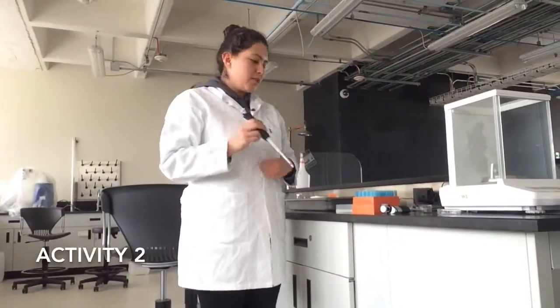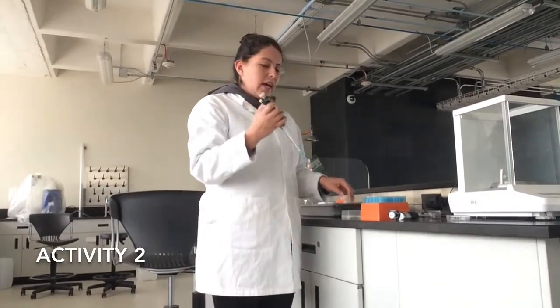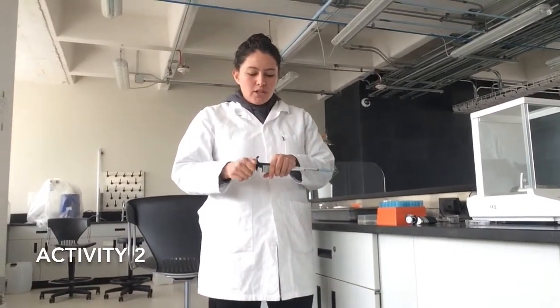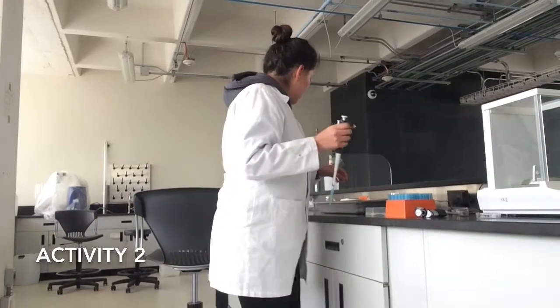For the practice number 2, we're going to take a tip for our micropipette, and we're going to set it in 330 microliters. We're going to take a sample of water 3 times, and this will have to add up 990 microliters. And at the end, we're going to recover the total volume we have in our little microtube, and it should be this exact amount that I've mentioned. And if not, we're going to calculate the difference.